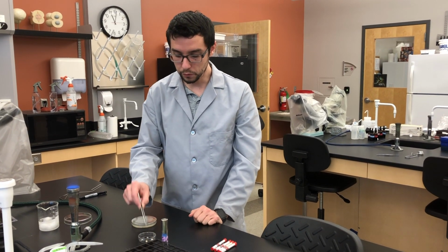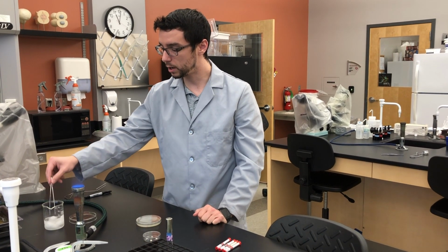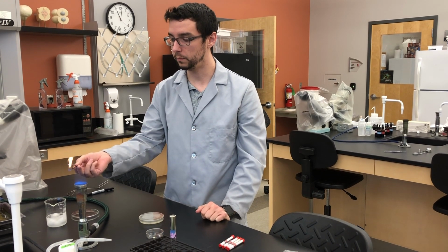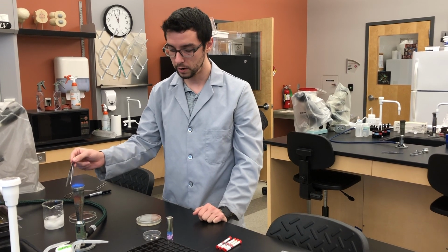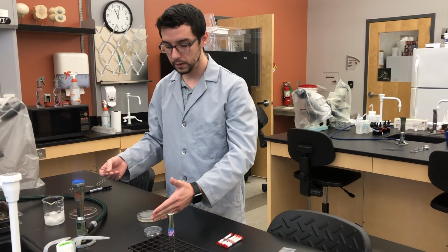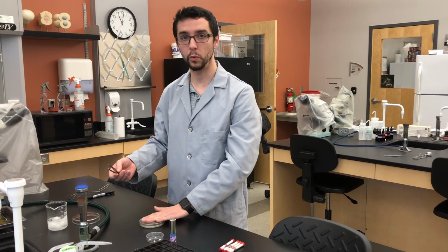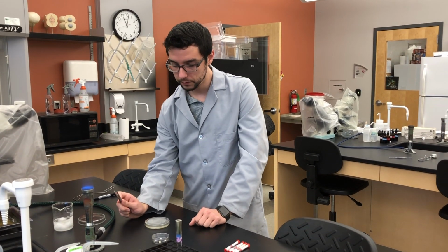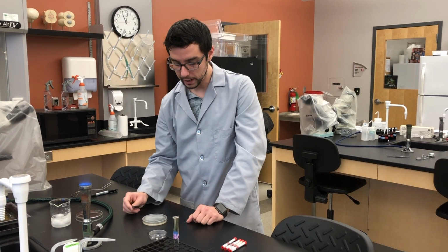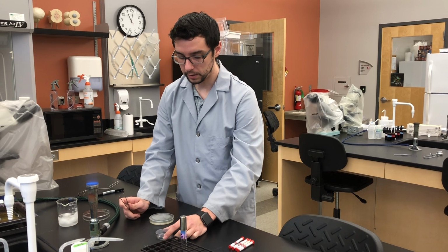Before we move these onto our petri plate, we want to sterilize our forceps. So just like with the spreader plate, we're going to dip it in alcohol and flame. The reason for this is we want to make sure that anytime we are contacting our antibiotic, we are not already adding culture there that may not be what we're wanting to assess. Okay? So, let these cool. You don't want to burn your antibiotic disc or the bacteria that you might potentially come in contact with when putting the disc on the culture. So give it a little bit of time.